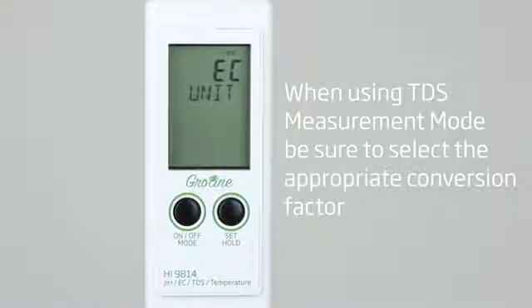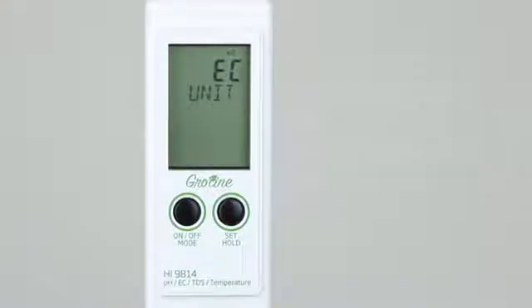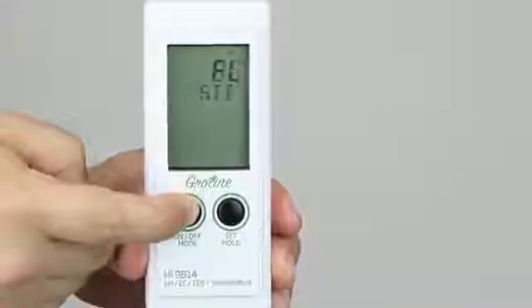Once you've selected your preferred measurement mode, EC or TDS, press mode again to choose your calibration type.